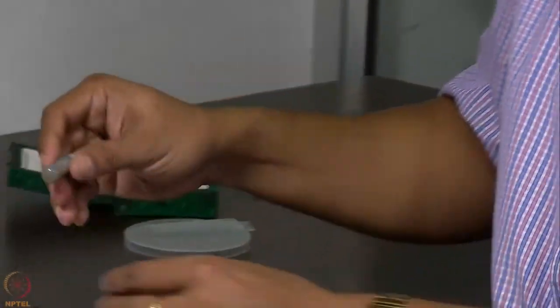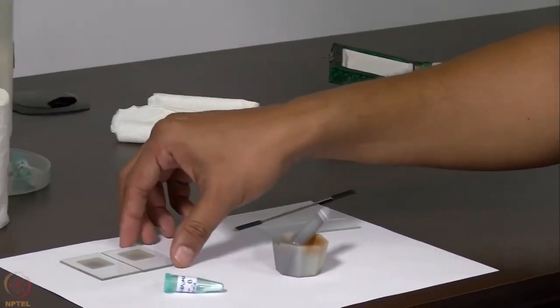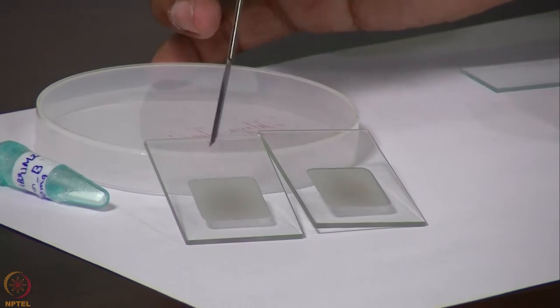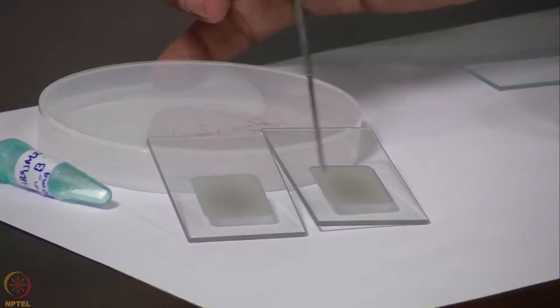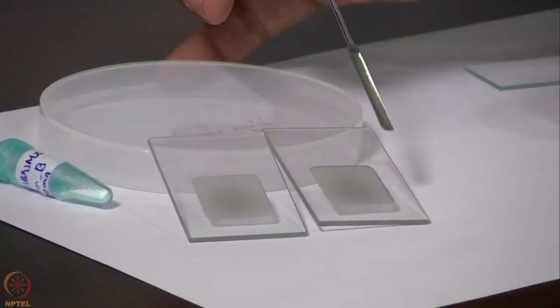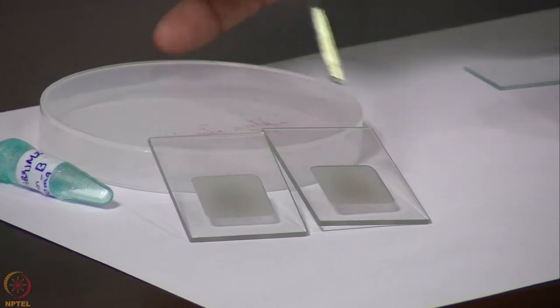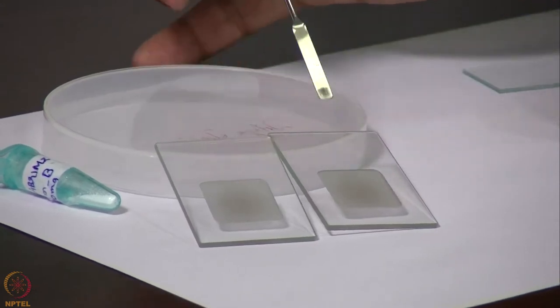Once we have powdered a sample using this mortar and pestle, we need to transfer it to these sample plates. These are the sample plates on which we need to spread our samples. You can see that the central region in these plates is etched, and these etched plates have different depths. Depending on the amount of sample that we have, we should choose a particular sample plate so that we fill the entire groove with our sample.